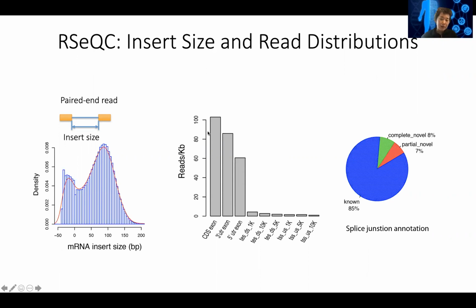The next one is a very, very good QC measure, which is how many of those reads are mapped to the coding exons in the genome. This is just a histogram. This is not the percentage, but you can see here, most of the reads are aligned to coding exons, then to 3' UTR exon, 5' UTR exon, and the rest. There is always some little noise, which is kind of expected.